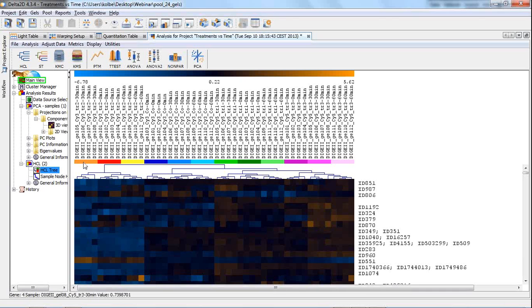Otherwise, either the images would be mixed up, maybe an orange image would appear with the green group, if it would be similar to a replicate there, or groups would be mixed between cell lines. And all this is not the case here. We can see that not only groups but also cell lines are separated very well, and this is a very nice sign for our quality. If it appears that some images have left their groups, then you should review the image carefully and then maybe also decide to exclude it from the analysis. Then you could just exclude it from the quantitation table and start this analysis once again.